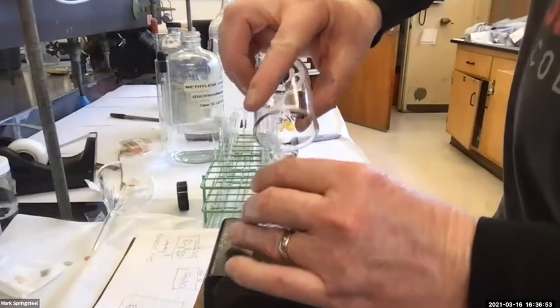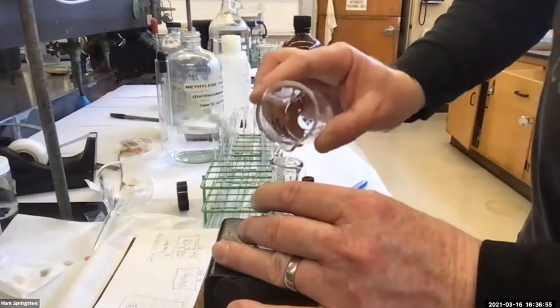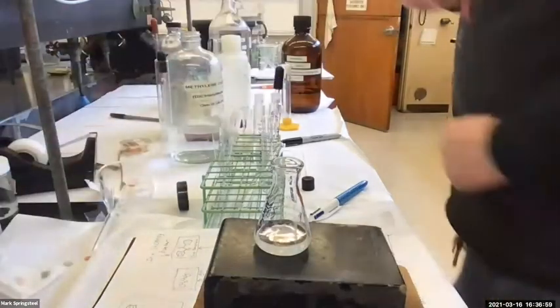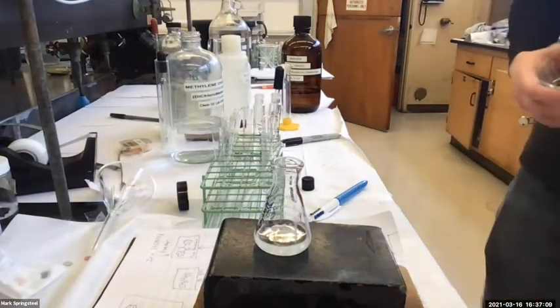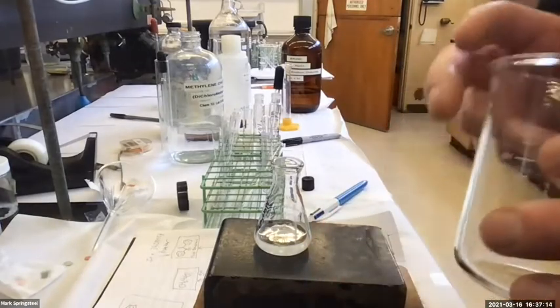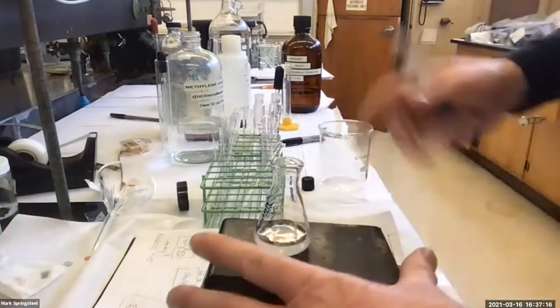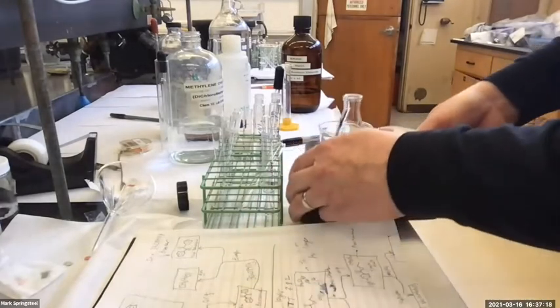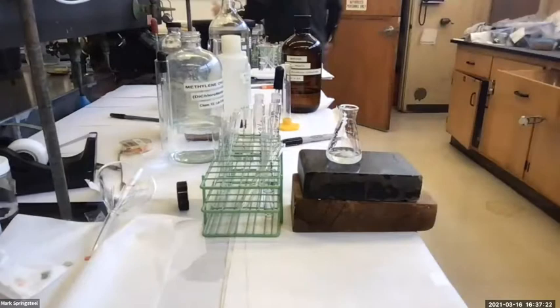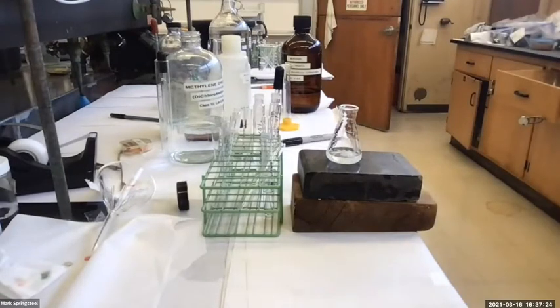Give it a couple rinses. And let me get a different beaker. You know what? I'm going to try a bigger beaker this time. See how it goes. I'm going to try this big one. So I'm going to just leave the computer here. Trust me on my measurement of mass. So the scale is reading 0 currently.